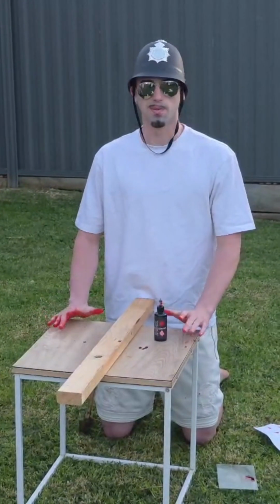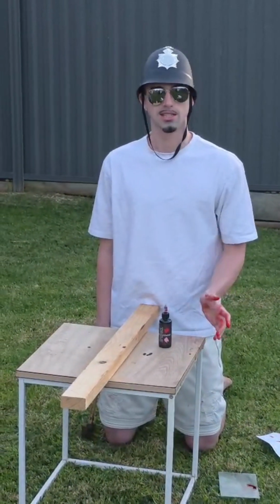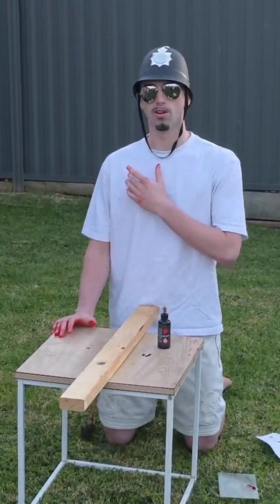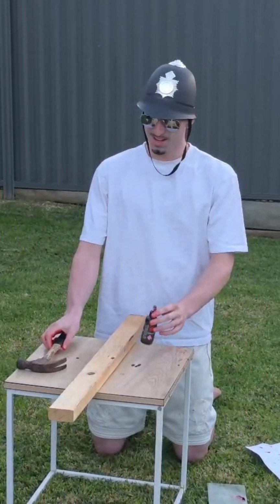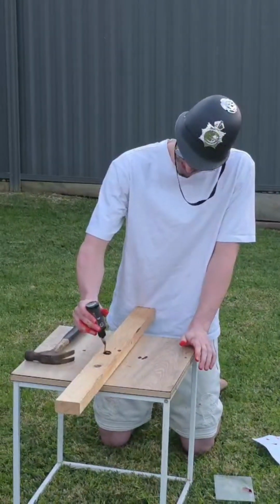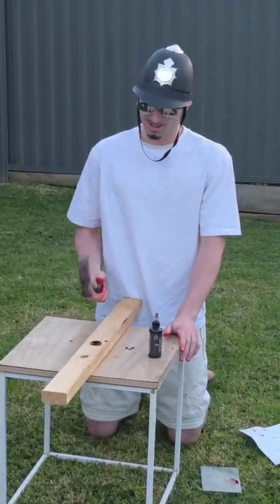Now we're going to talk about spatter patterns, and spatter patterns is when an external force hits an object, say someone has been shot in the shoulder and it spurts out the back, or someone has been hit with a hammer. So what I'm going to do is put just a bit of blood on this piece of wood, and we're going to use this hammer and hit it.